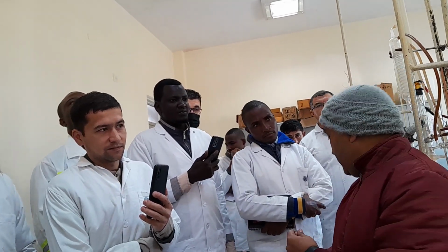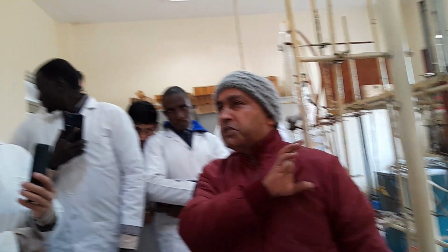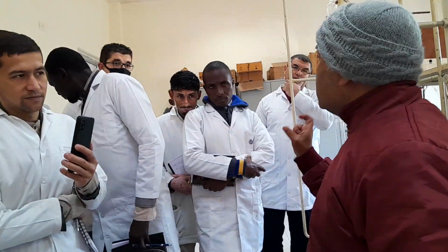Again, if I am taking 20 liters of the sample, it takes 5 days to complete the distillation up to 370 degrees centigrade. You have to be very careful. When I start the distillation over here, I stand here the whole time, with no lunch, no breakfast, nothing. You have to stay here, because the unit you are seeing is totally manual, not automatic. So whatever is happening inside, you are fully responsible for that.